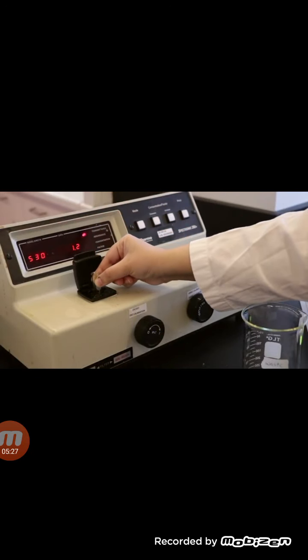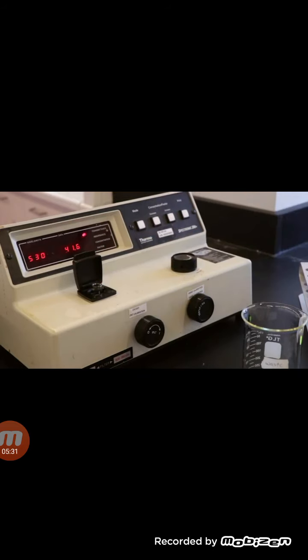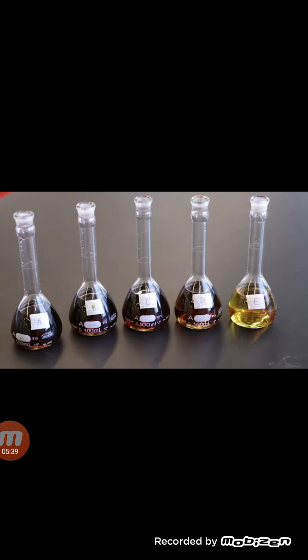To measure the percent transmittance of your standard solutions, rinse and fill the cuvette with the solution and place it in the holder. Close the lid and record the percent T value displayed on the Spec 20. Record the percent transmittance for all 5 standard solutions. You should analyze your standard solutions in a random order. Note the color gradient from flask A to E. As the concentration of sodium salicylate decreases, the color becomes lighter.